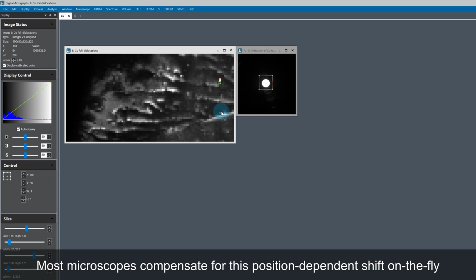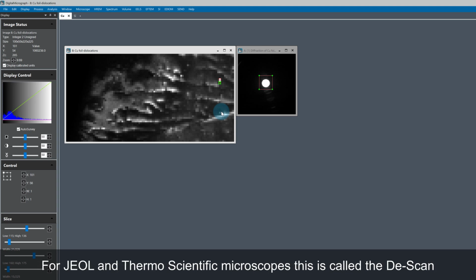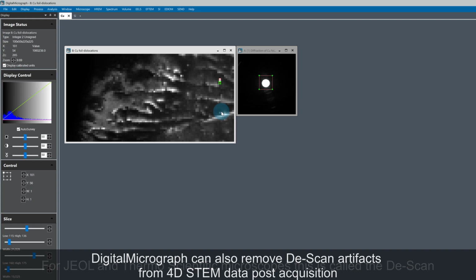Most new microscopes include optics to correct this position-dependent shift on the fly. On both JEOL and Thermo systems, the correction is called De-Scan. De-Scan artifacts can also be removed from 4D STEM data post-acquisition using Digital Micrograph.